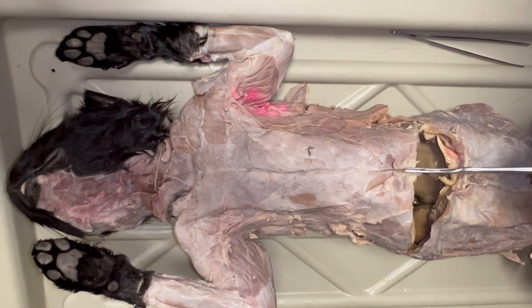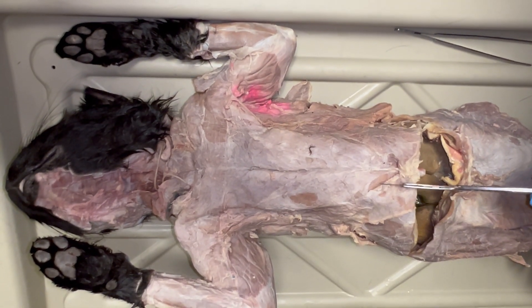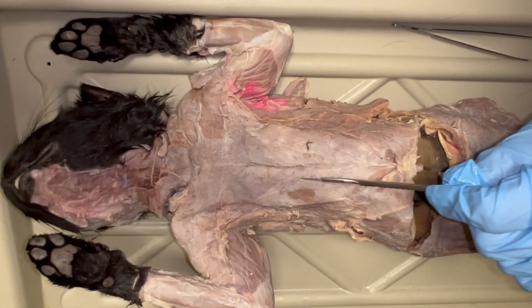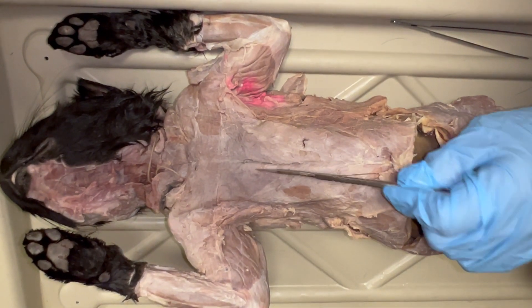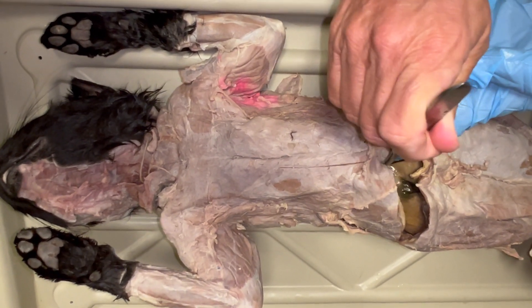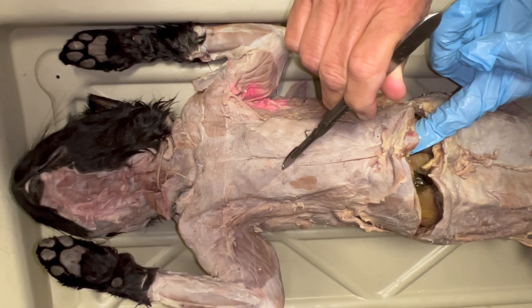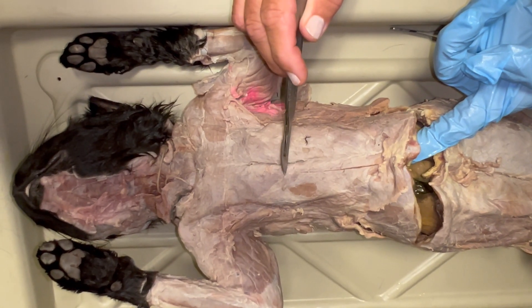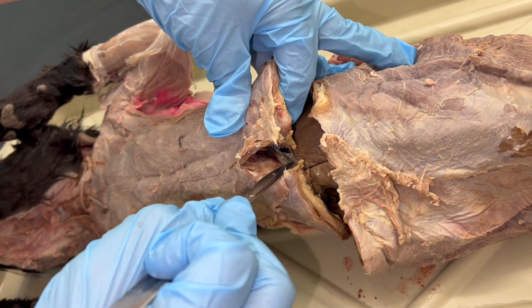The next part will be to cut, and you need to be off the midline — we're trying to avoid the sternum here. So maybe a little bit to your cat's right, and you'll be cutting a line along here, to this thickness, maybe to about where the base of the pectoralis major is, so about halfway up the rib cage.